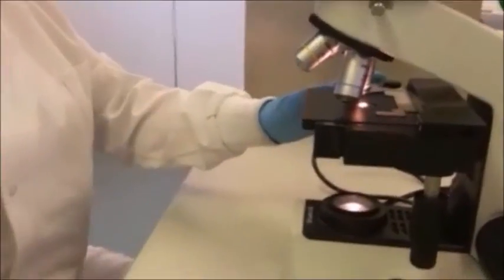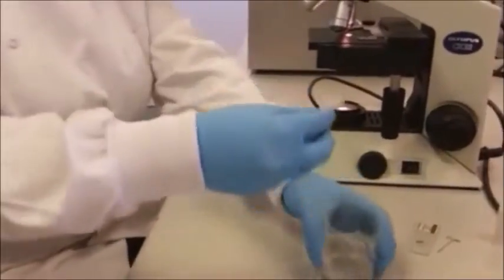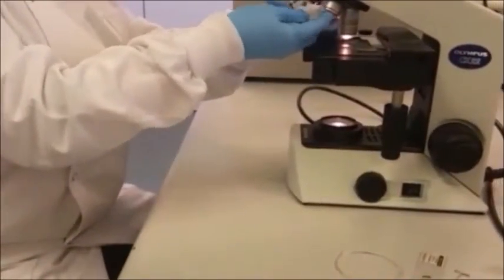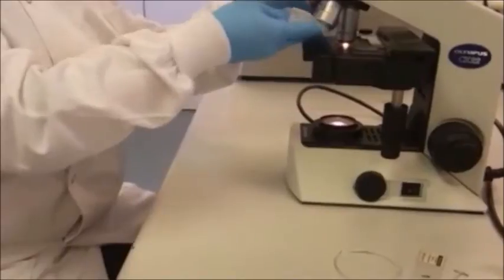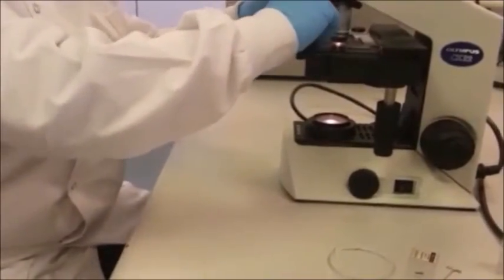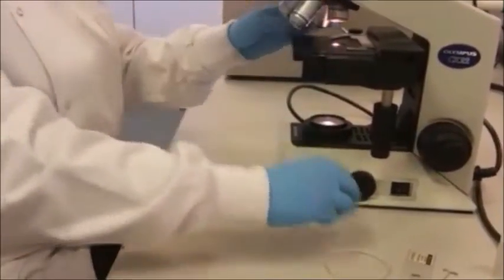Remove the prepared slide and clean the objective lenses with IMS starting from the lowest lens. You then turn the microscope off at each three places again.